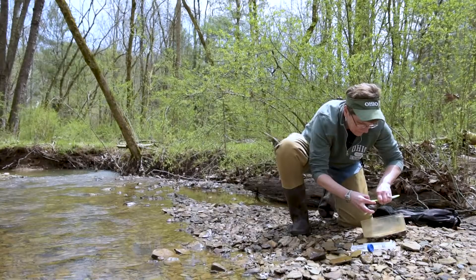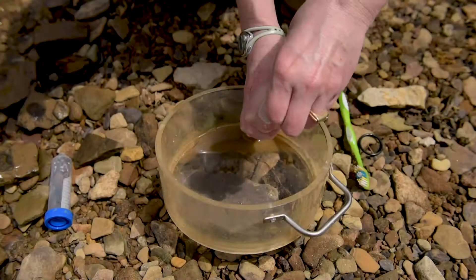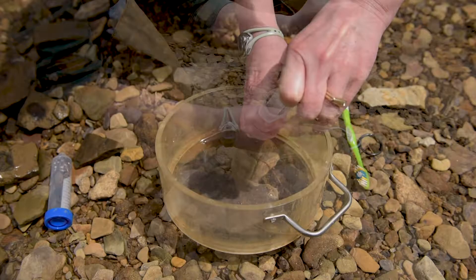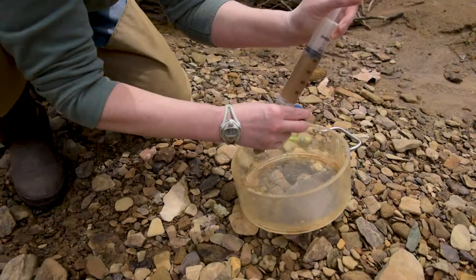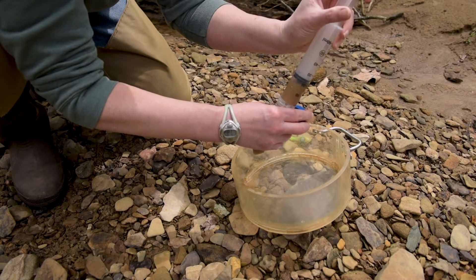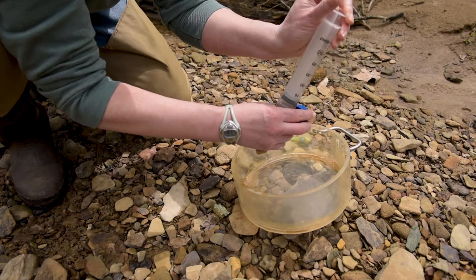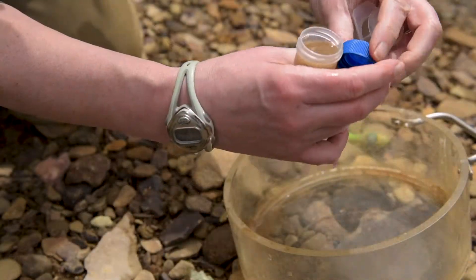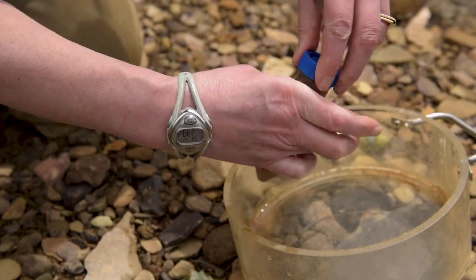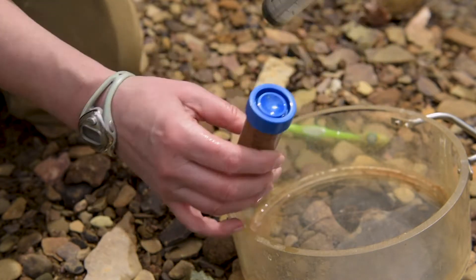Keep scrubbing until you have finished all 10 rocks. Then, when you are all done, it is time to suck up all that water with either a syringe or a turkey baster into your tube. Voila — your algae rock scrub sample. Now you are ready to take your sample back to the lab to look at the diatoms and measure the chlorophyll A.